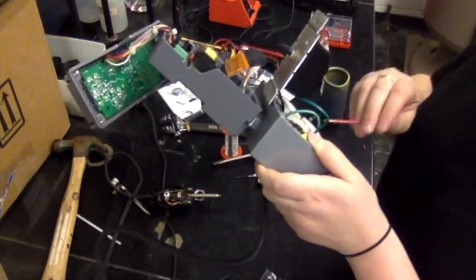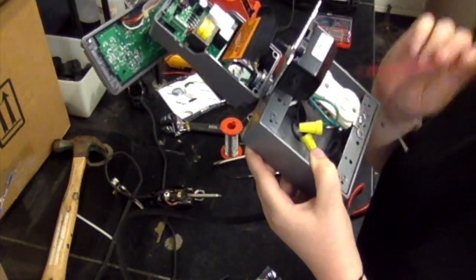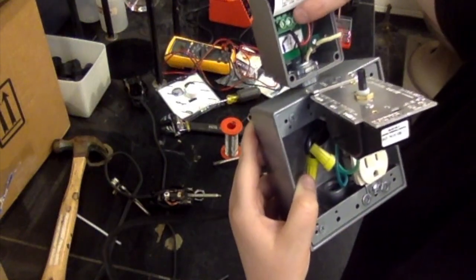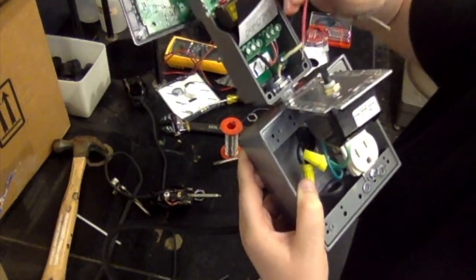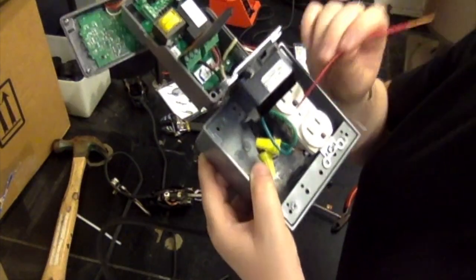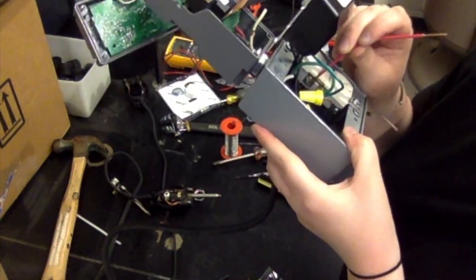So if you look at everything that we have connected, you should have just the white cord left from the line cord. Again, you'll need to push that up through into A419, and that's going to need to connect at port 2, which is this one right here. And then I'm also going to take this piece here and put it into port 2, and the terminal end of this is going to hook around. I'm going to use a needle nose plier to loop it and put it onto the silver side of this two gang outlet.